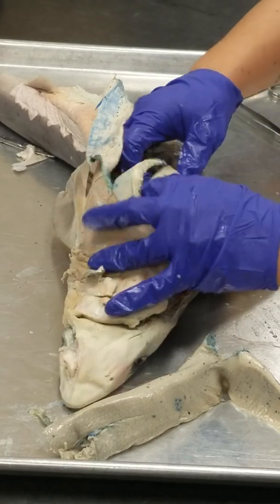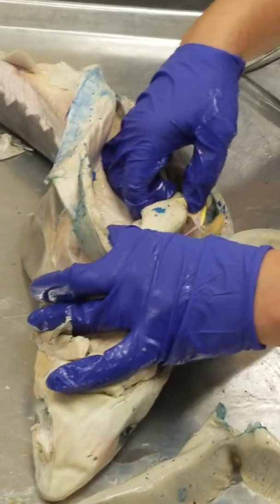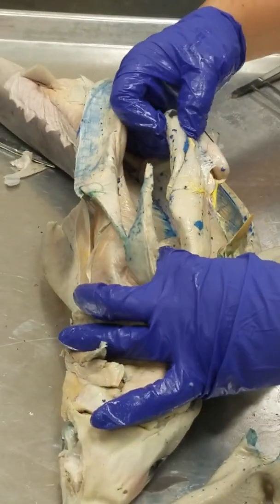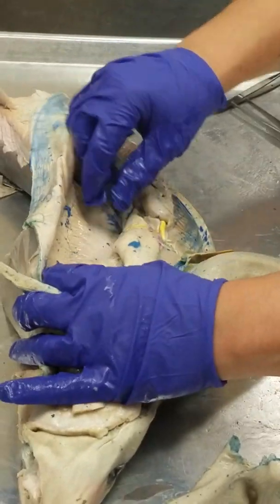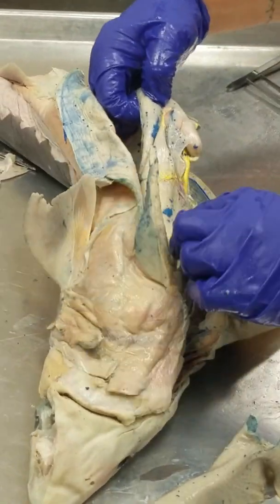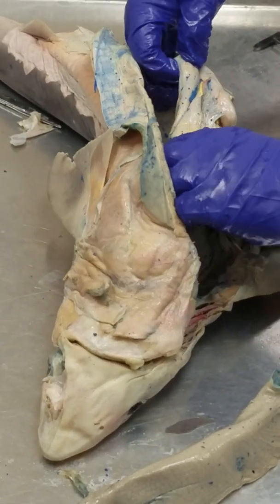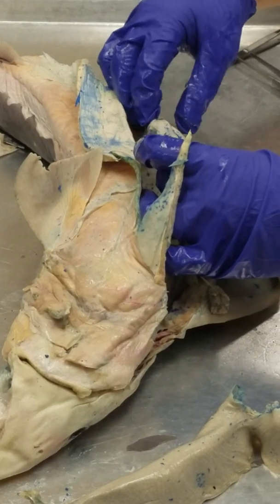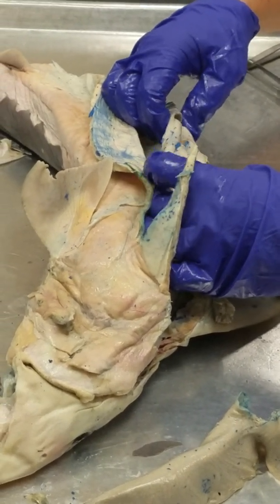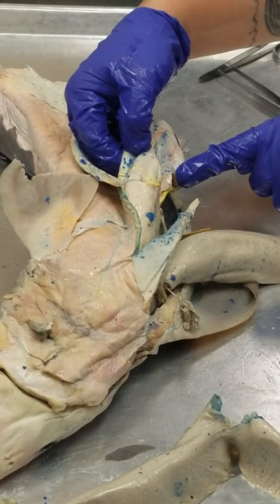Sorry, Gino. Okay, so look, here's the esophagus, and I'll tell you how to tell the difference, but we have to look inside. The stomach is this big J-shaped organ. So see, it comes down like this and then comes up like this. So the J has a big curvature called the greater curvature of the stomach, and then the inside of the J is the lesser curvature of the stomach.